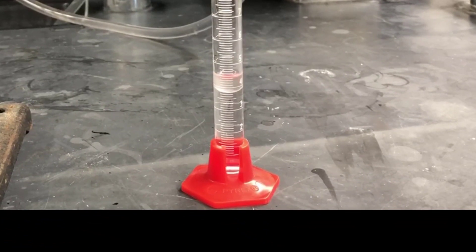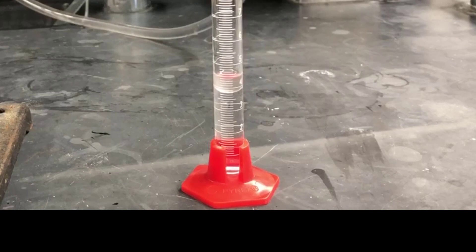There are two layers. One is the cyclohexanone and the other is the water layer. At this point, I'll stop the distillation and move on to the next step.